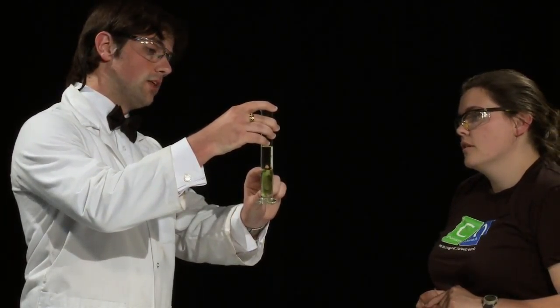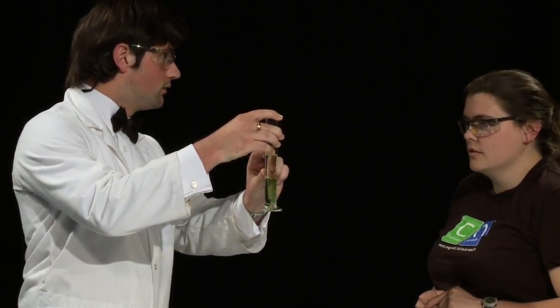So 20 milliliters of water with 20 milliliters of oil on top equals 40. There we are. Now pass me the water and methanol mixture will you Trudy?